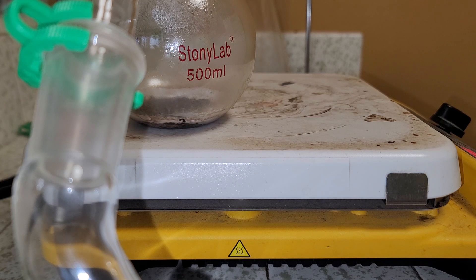And that is what is occurring here. I had this on my smaller blue hotplate, which can only reach 280 degrees Celsius. The big yellow hotplate can reach 400 degrees Celsius — it's currently at 335 degrees. In reaching the higher temperature, I've noticed a little bit more difference than what the blue hotplate was producing. There were a little bit more impurities burned off, because the scent came over the helm indicating this, and also because there was a smoky vapor or fume risen in the cucurbit of the alchemical alembic.